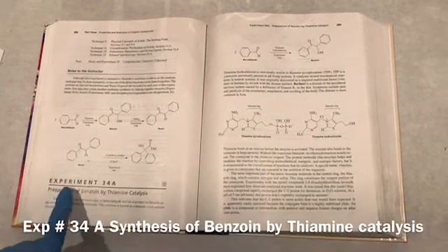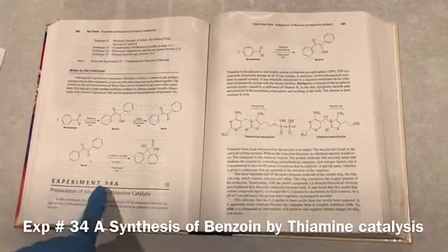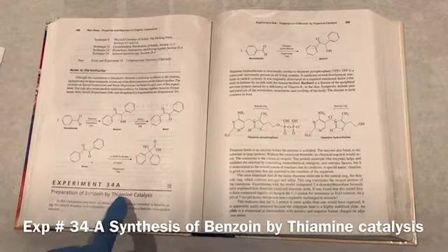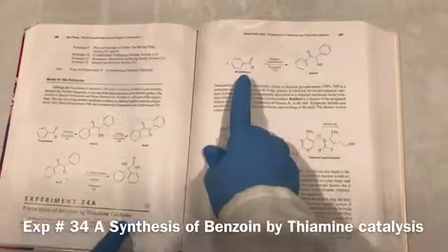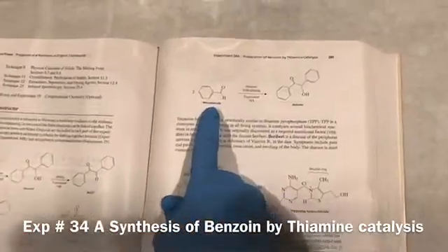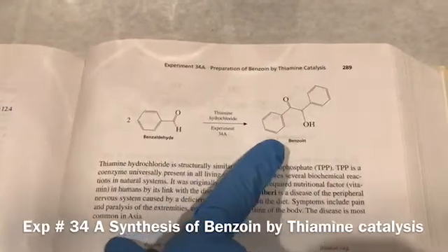Today we are doing experiment 34a: preparation of benzoin by thiamine catalysis. This reaction involves benzaldehyde — two moles of benzaldehyde react in the presence of thiamine hydrochloride and convert into benzoin.